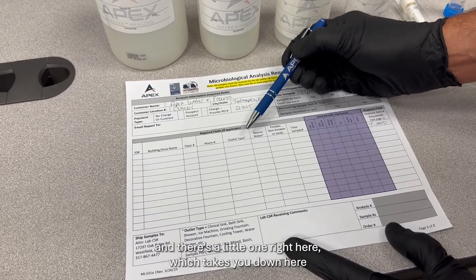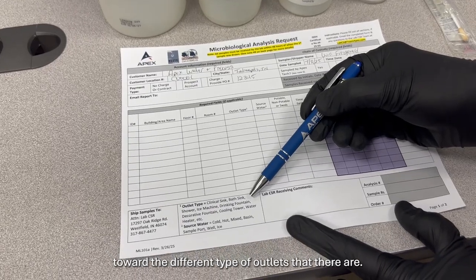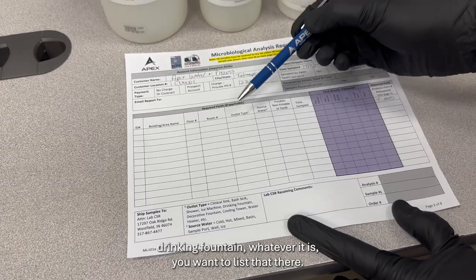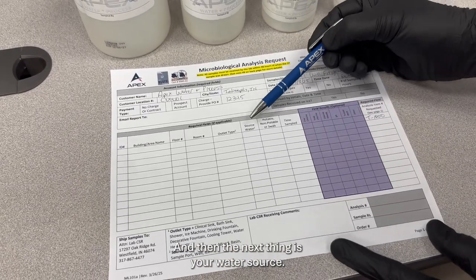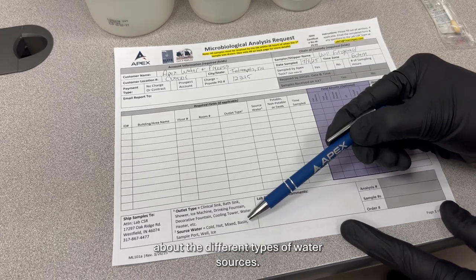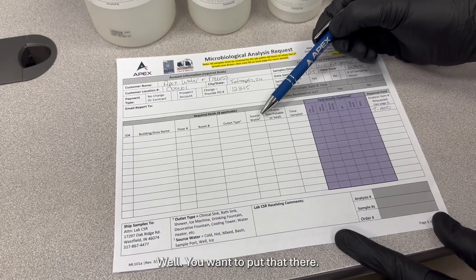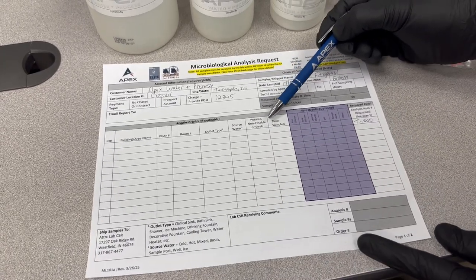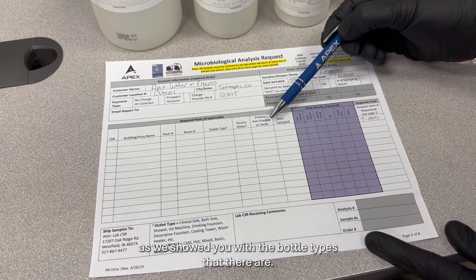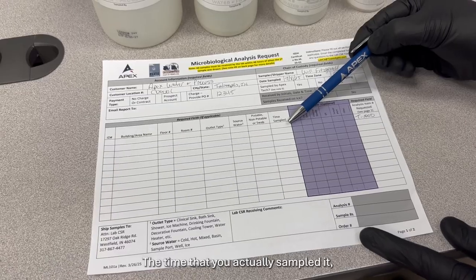The outlet type, and there's a little 1 right here, which takes you down here to the different types of outlets that there are. So whether it's clinical sink, bath sink, ice machine, drinking fountain, whatever it is, you want to list that there. And then the next thing is your water source. There's a 2 next to that, which talks about the different types of water sources: cold, hot, mixed, basin, sample port, well. You want to put that there. You want to indicate whether it's potable, non-potable, or a swab, as we showed you with the bottle types. And the time that you actually sampled it.